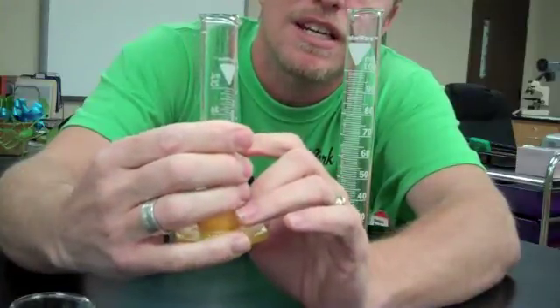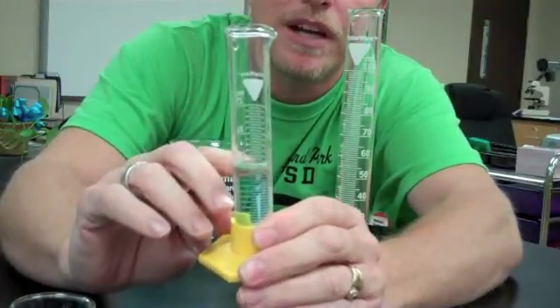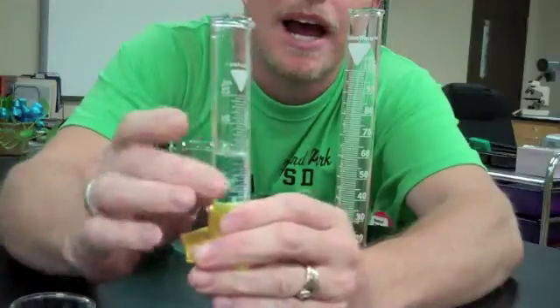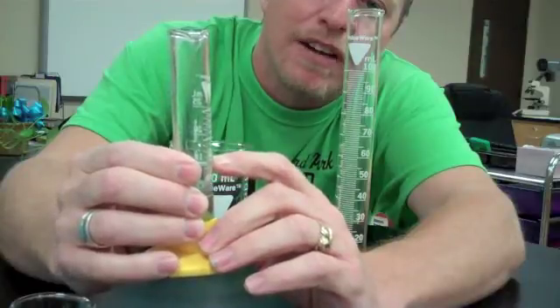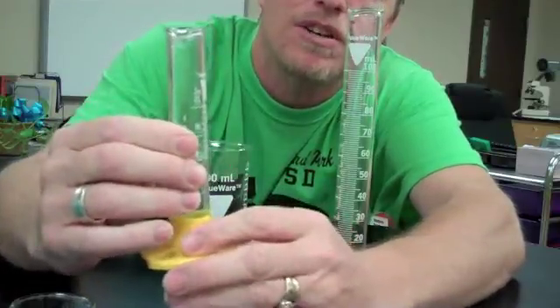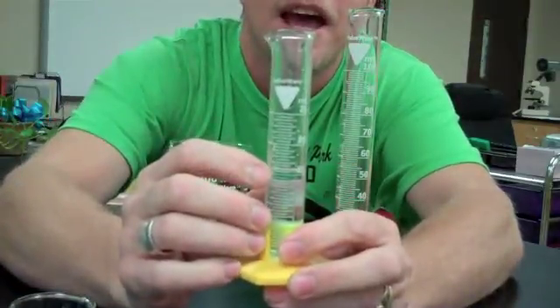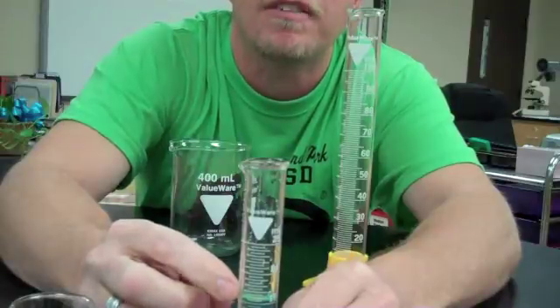Actually, let me back up on that. If we had half of those marks, each would be representing one of those. So it's going 15, mark, mark, mark, mark, mark, and then the halfway point. Then mark, mark, mark, then 20. So if I look at that, it's going to be going up by half a milliliter: 15, 15.5, 16, 16.5, 17, 17.5, 18, 18.5, 19, 19.5, and 20. So this one registers to half a milliliter. It was one line above the 15, which tells me that line above is a half milliliter. So I have, accurately and with greater precision, 15.5 milliliters of liquid.